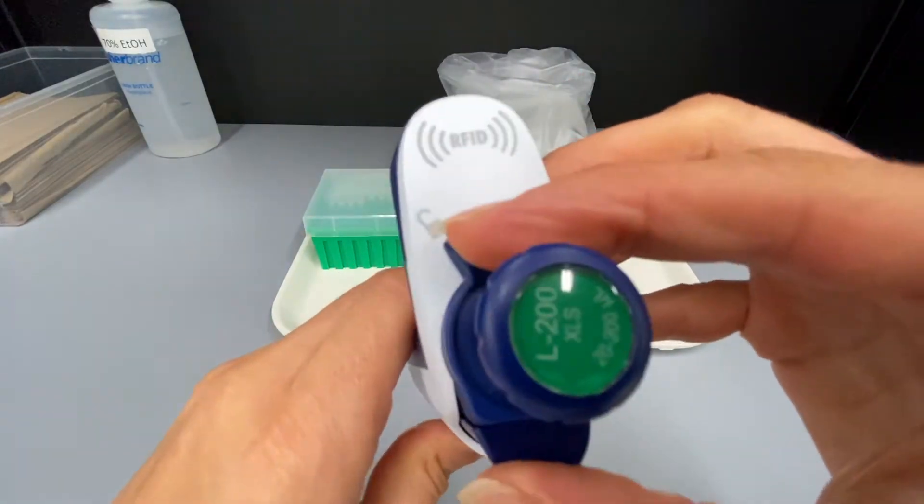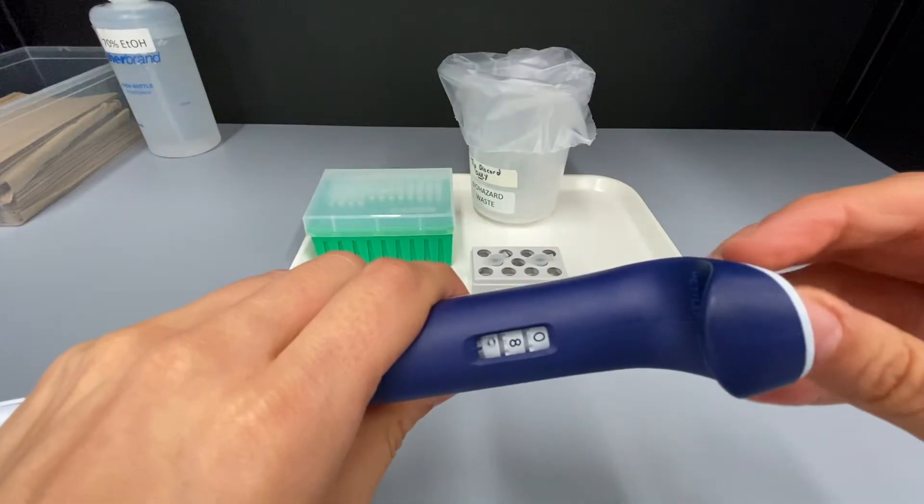I will now demonstrate how to transfer 100 microliters of solution from one tube to another.